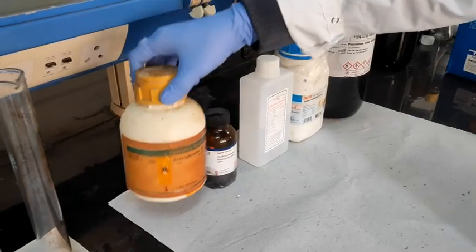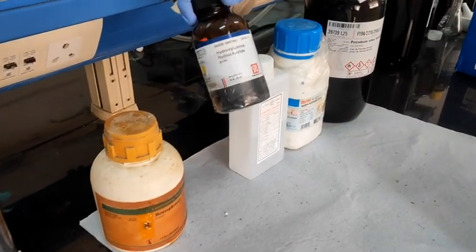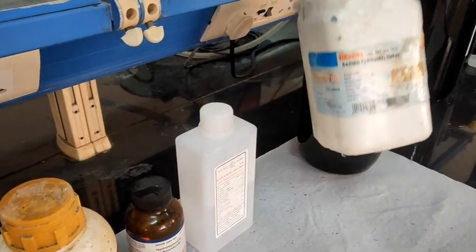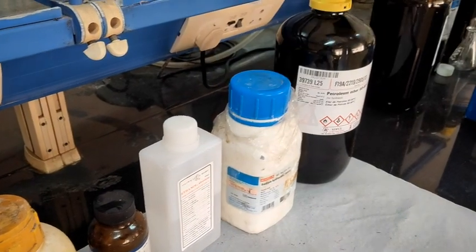Today will be our second laboratory session for Pharmaceutical Chemistry. It will consist of two parts. The first part will be the synthesis of benzophenone oxime, and the second part we will synthesize benzanilide. Chemicals required will be benzophenone, hydroxylamine hydrochloride, ethanol, sodium hydroxide, and ether.